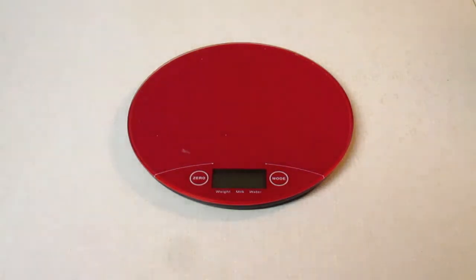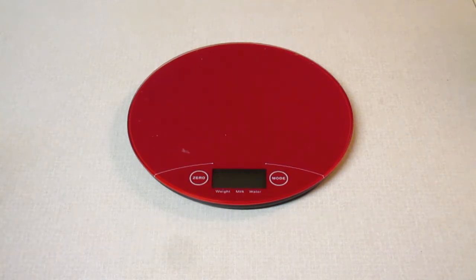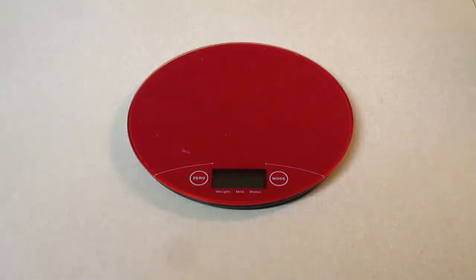In this lab, which is Lab 2, Composition of a Mixture, the objectives are to understand that a mixture is made up of several entities, to separate a mixture, and to come up with a percent of the sand in this mixture.